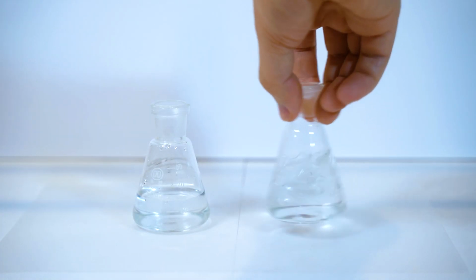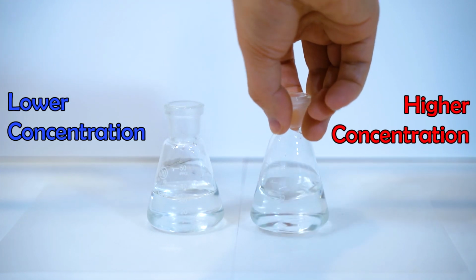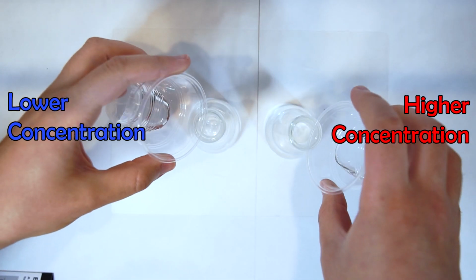Now let's test concentration. The flask on the right has a higher concentration of potassium iodide, which is one of the reactants. Which one do you predict will change color first? Let's see.